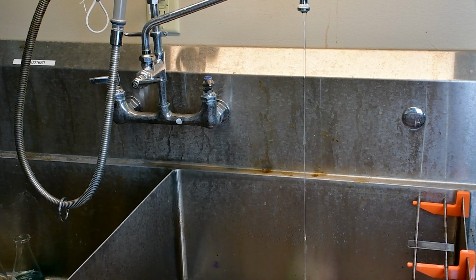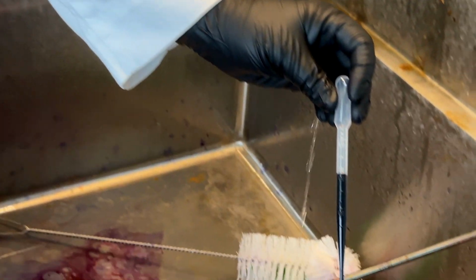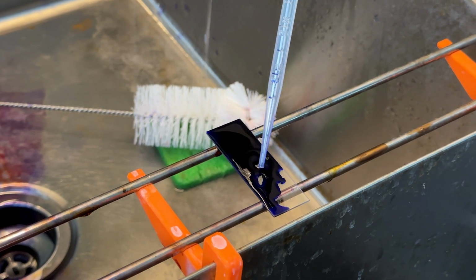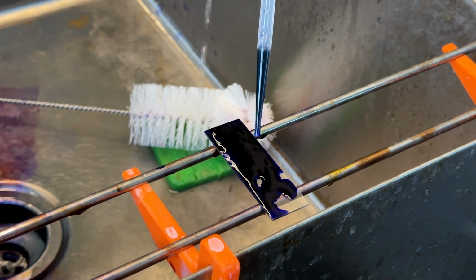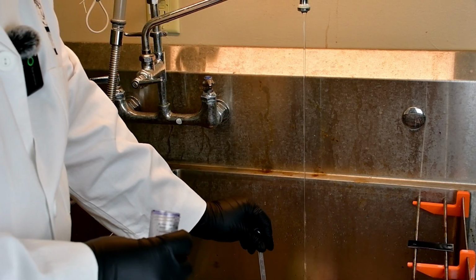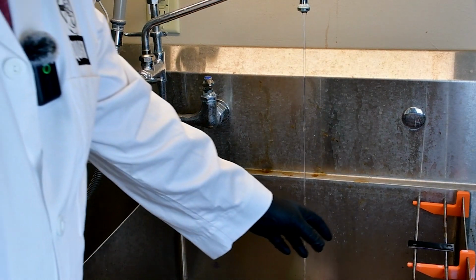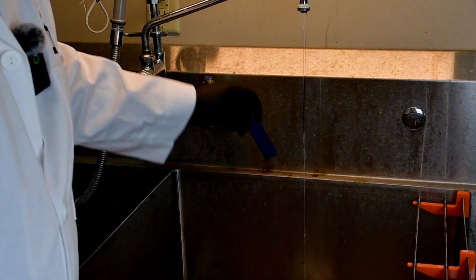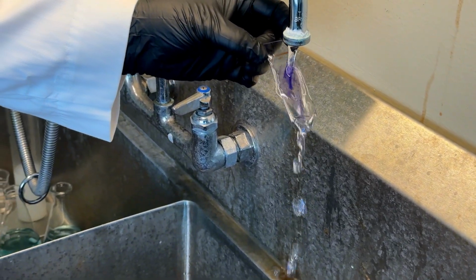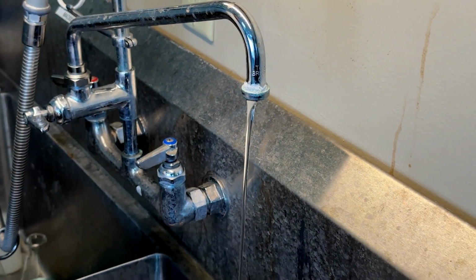In the same way that I did with the Gram stain, I'm going to coat the entire slide. Now, a little bit more in there. And then this one, I'm going to start my timer, but this is only 30 seconds. It is not the full minute that we've seen before. I'm only putting this on for 30 seconds. And at 30 seconds, I'm going to rinse this off in the same way that you've seen before, running the water down the slide. Set it back on my rack.